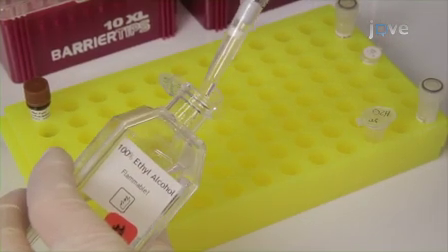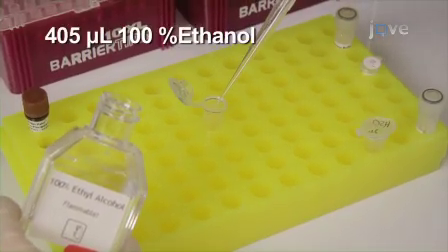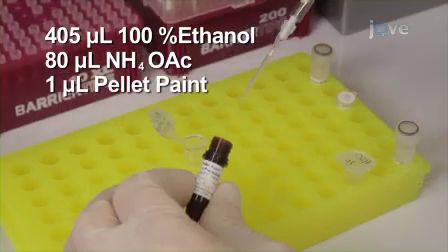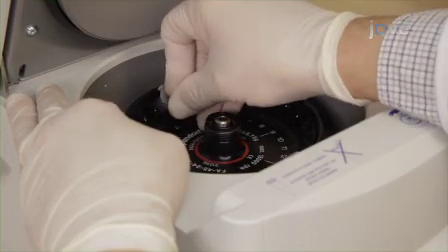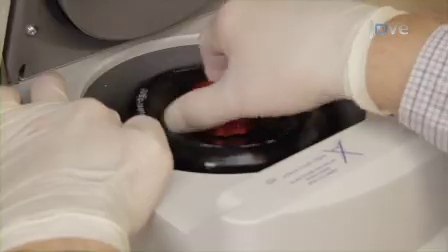Add the following to the 1.7 milliliter microcentrifuge tube: 405 microliters of 100% ethanol, 80 microliters of ammonium acetate, and 1 microliter of pellet paint. Vortex briefly. Place the tube in the centrifuge with the hinge of the tube facing out and centrifuge at full speed for 20 minutes at room temperature.